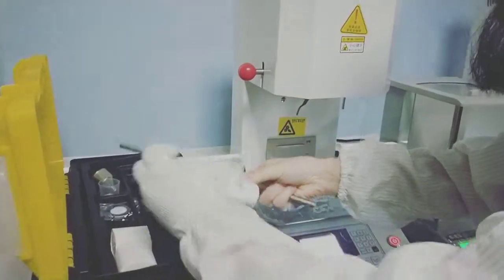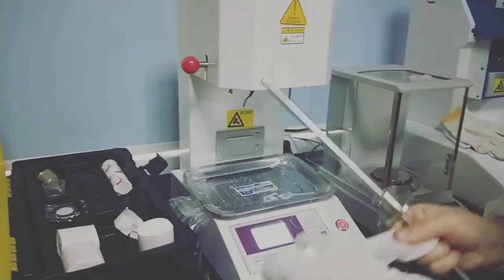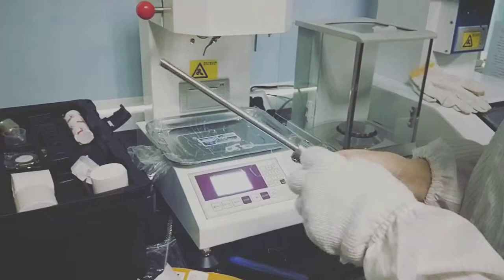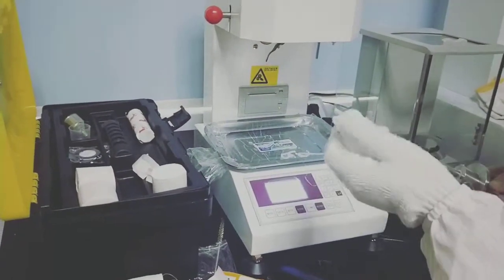Use the cleaning cloth to clean the sample rod. We need to clean the machine when it is hot.